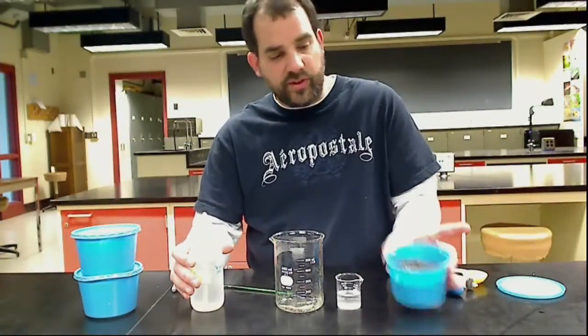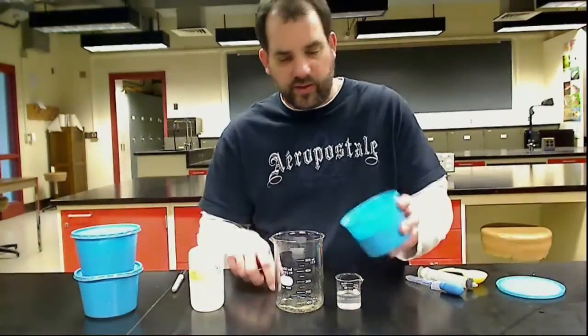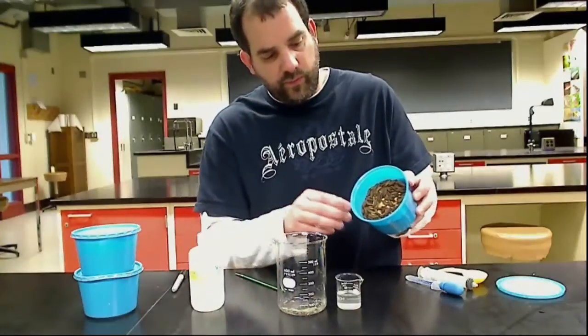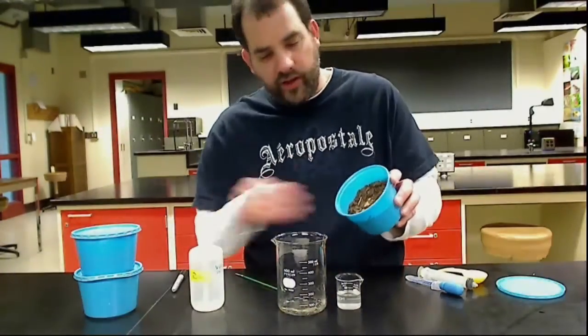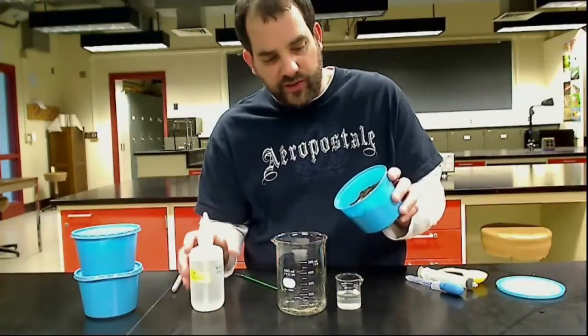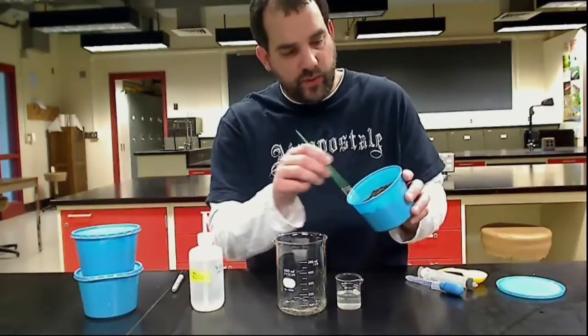You can also do it with the ones in the cup if you're very careful. Sometimes if you try to tilt this over, the wax worms on the top can be loose and they'll fall in, and you just get your sample all messed up with sawdust and dead cadavers. That's why I want to use the paintbrush.